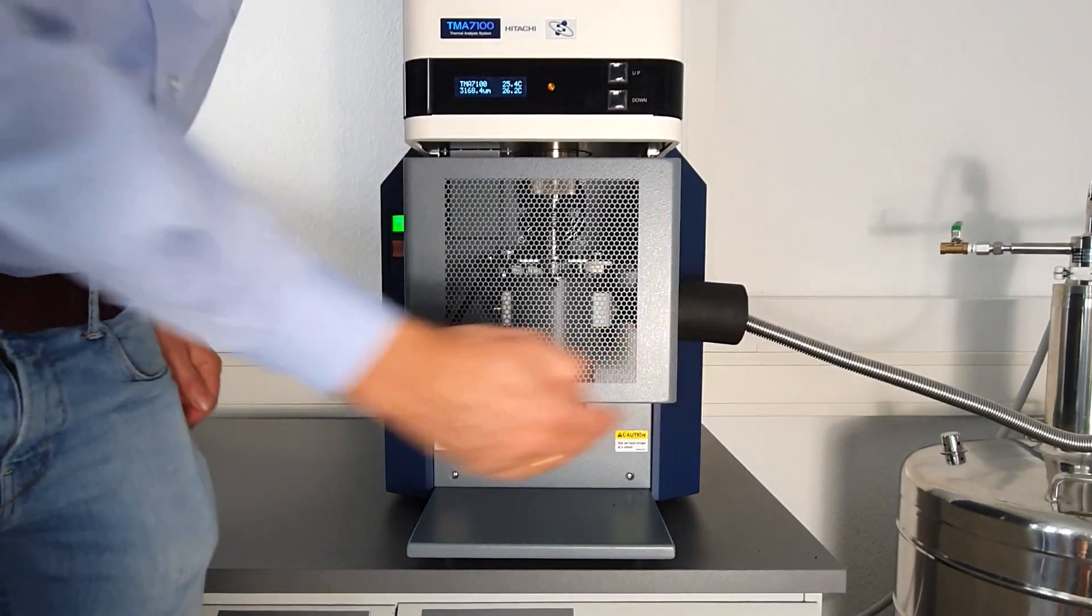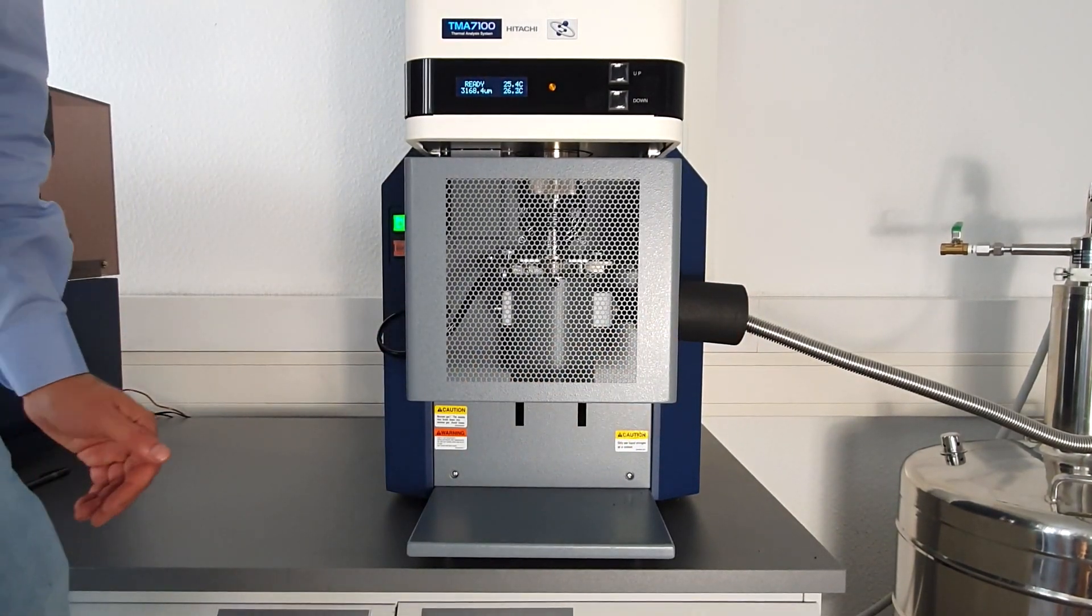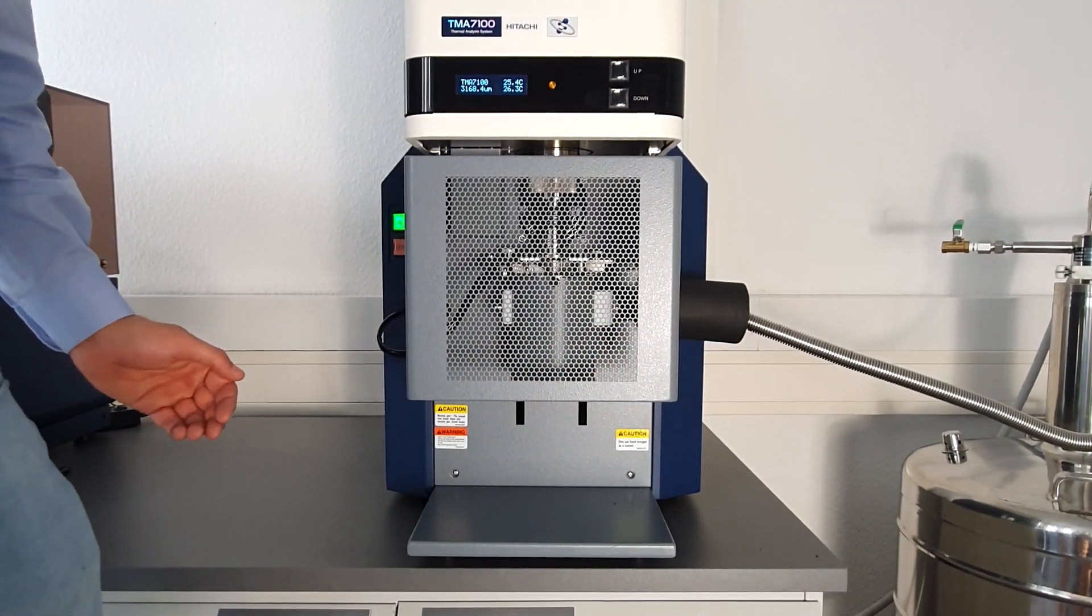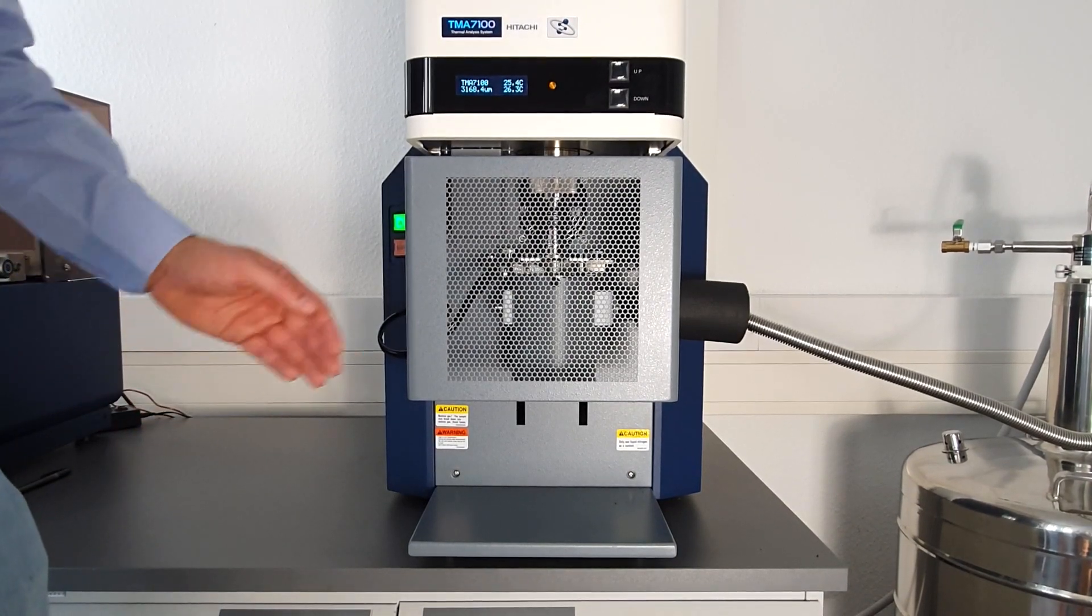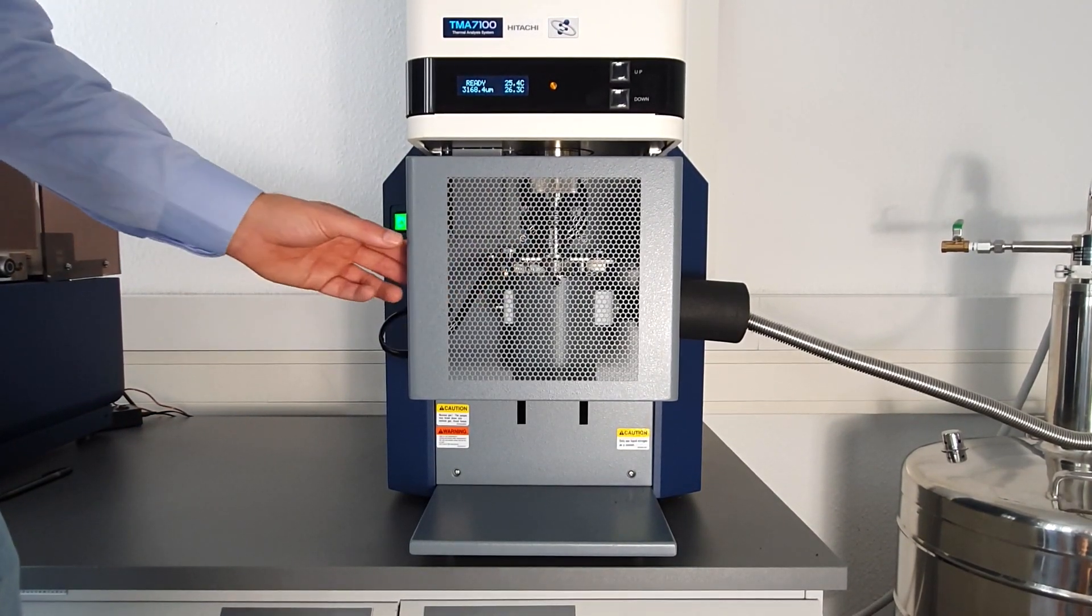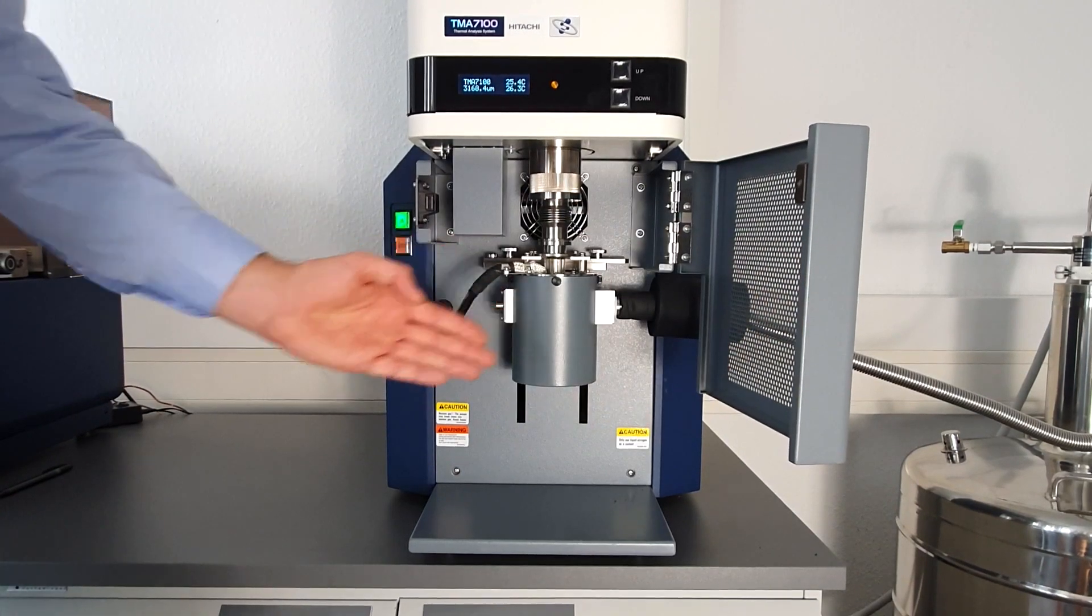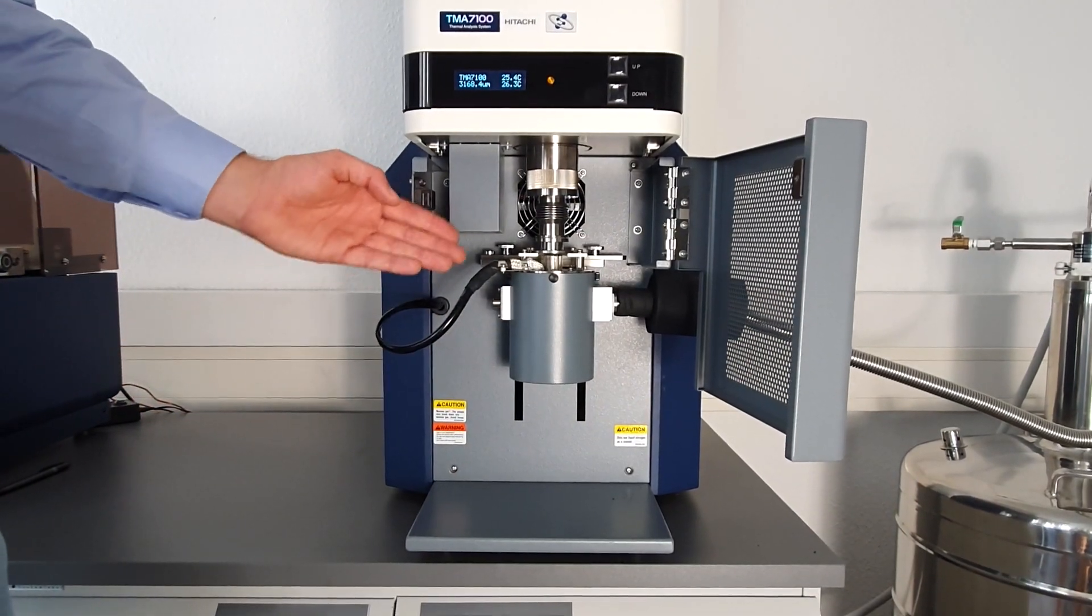On the one side we have the cooling options, in this case it's a liquid nitrogen cooling, but this may differ along your application. In front we have a safety cover which protects you from the furnace unit. Let me show you what's inside the furnace.